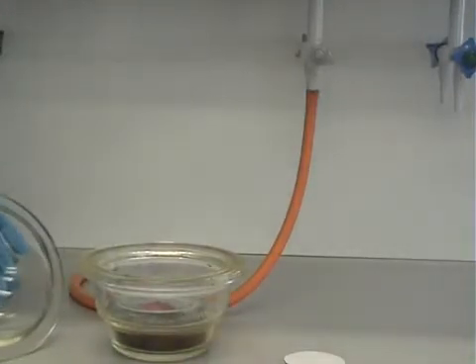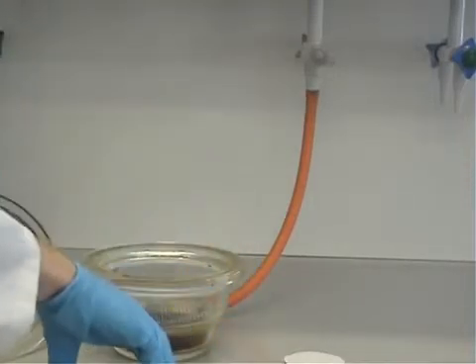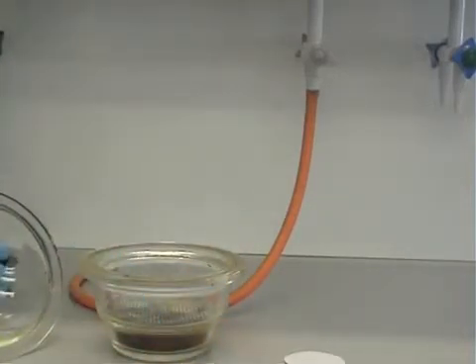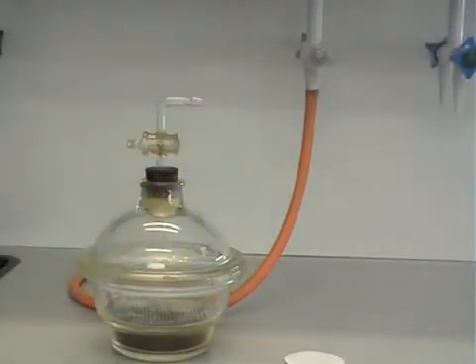You can then retrieve your dried sample. It is important when storing the desiccator that the lid is closed, and that the tap on the top of the desiccator is closed also.